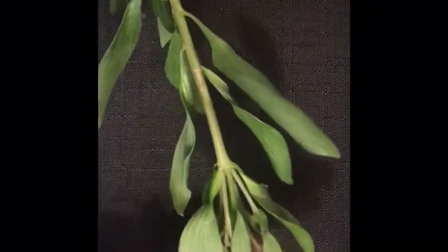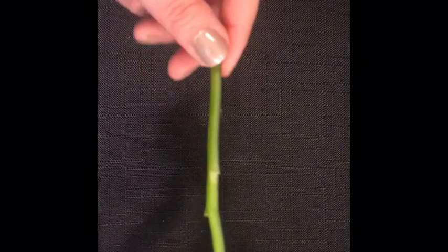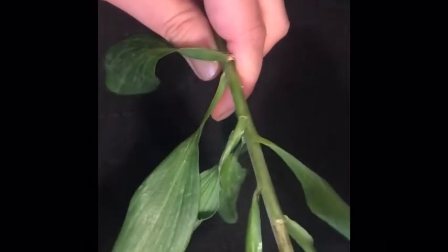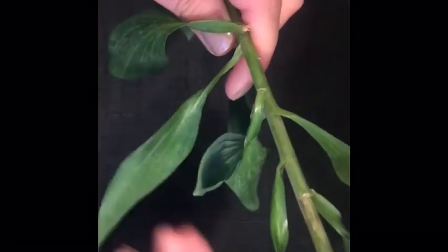So we're going to start with the different parts of the plant. So as you can see, as you all should know, this long piece is the stem. If this was a full plant, we would have some roots at the end, but we don't have the full plant because this is just cut flowers. So we just have the stem. Along the stem are all of its leaves, and the leaves are nice and green, and there's many of them because if this was in the soil, all of these leaves would be reaching towards the sun and trying to create chlorophyll in order to make food. So that's why the leaves are green.